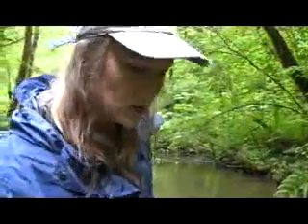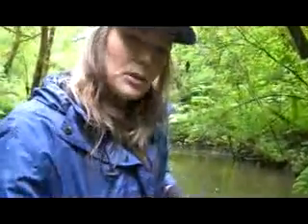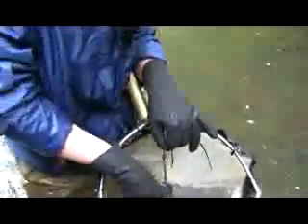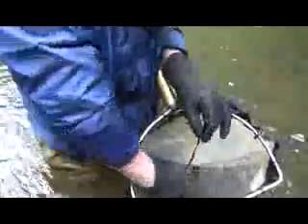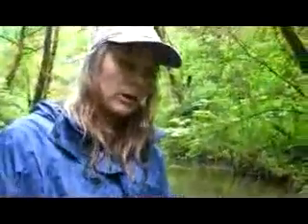And so just as we did before, you're going to take that sample and dump it into your net. You're going to wash everything down, wash the sides of the net down. Try and get everything in the bottom so you can grab hold of it. Again, you're probably going to be more likely to collect large pieces of organic matter, so you just want to go through and make sure you clean those off. Get any of the organisms that are on them off and take them back out of the sample. And that's how you're going to get your sample out of a slack water situation.